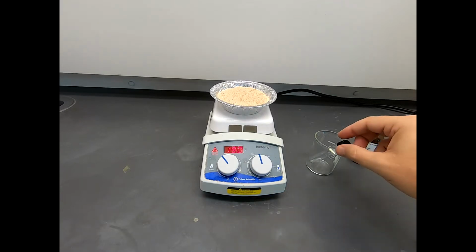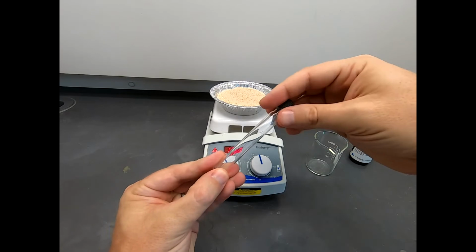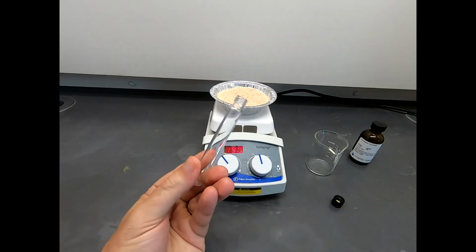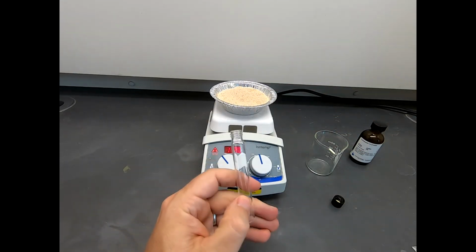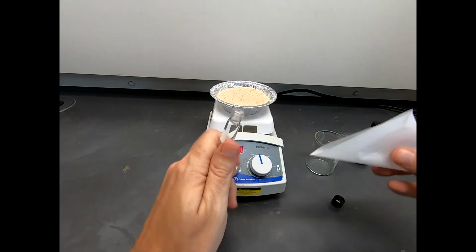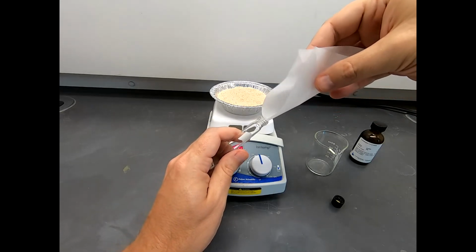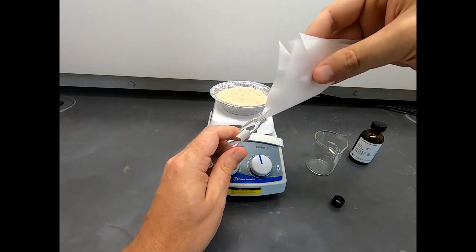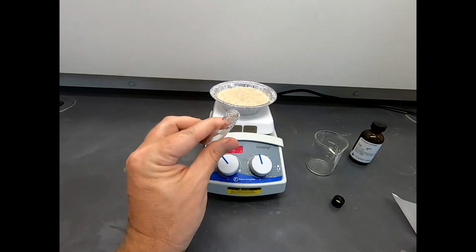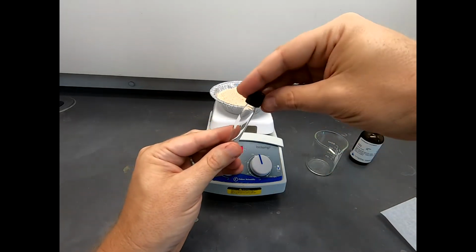Now our reaction flask, I call it a reaction flask, it's really just this glorified test tube with a nice twist cap on it. And to this, I need to add our maleic anhydride. There we go. That was a little delicate because some of those pieces are pretty big, and the mouth of that tube is not that huge. But that's our maleic anhydride.